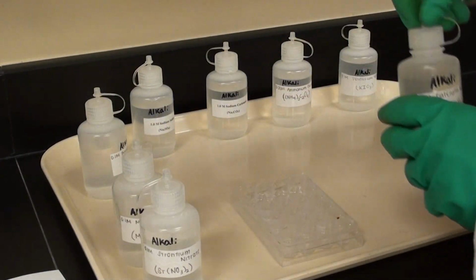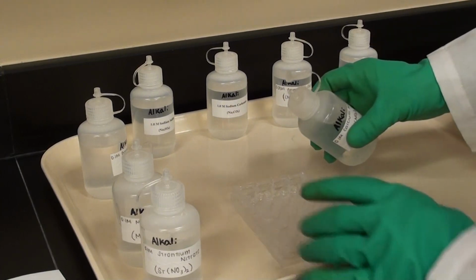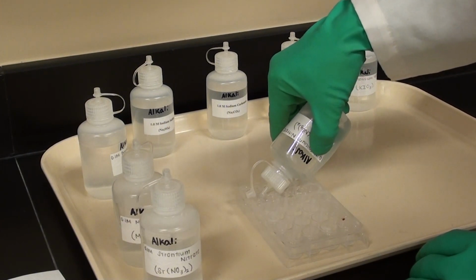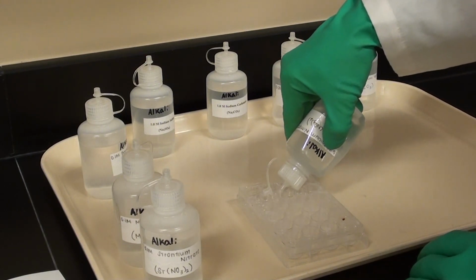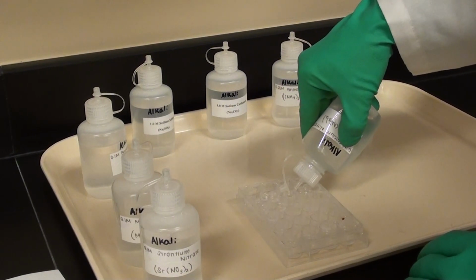Now I'm going to add... You can see he's put the bariums all across the top there. Now he's going to do the calciums on the next row. Be very careful not to contaminate the wells. He wants to make sure he doesn't put any calcium in where he's put the barium. But you can see what he's doing here. Alright, we'll leave it at that for now, and then we'll show you the final result.